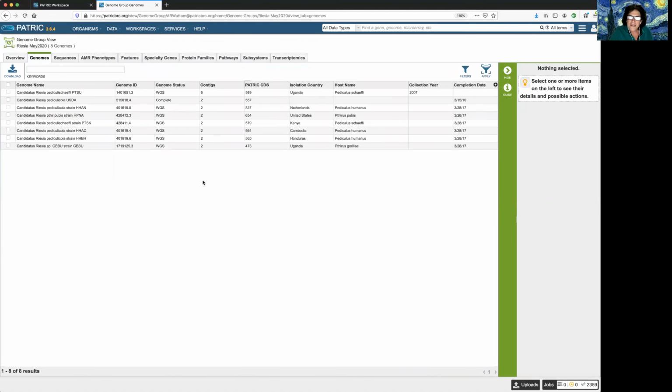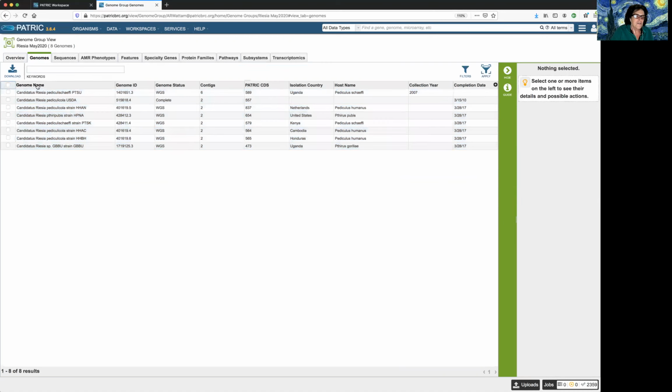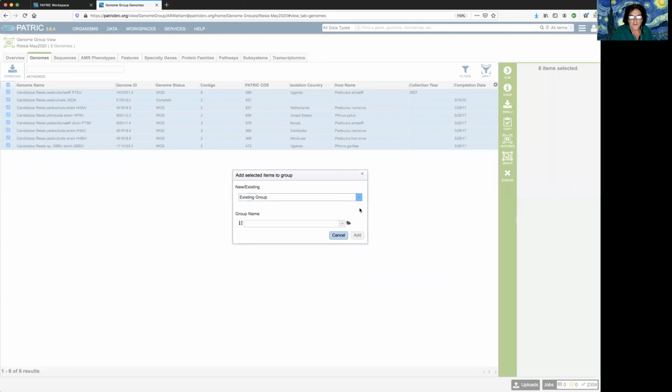Now I can weed things out right here if I want to, but I'm always a little bit nervous about that. So I want to create a new group and adjust the new group and not remove my favorite ones. So I click here, I did that too fast for you all, next to genome name, the check box immediately to the left of that, select all of them, and I'm going to create a new group. So you click on the group icon, it pops up this pop-up window. You click in this down arrow next to existing group and say new group.